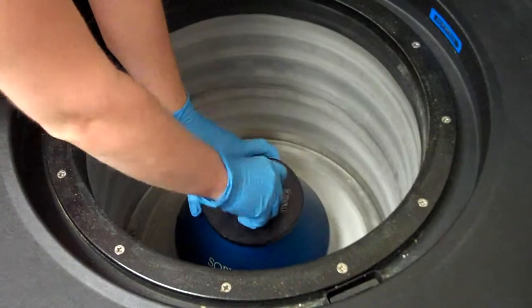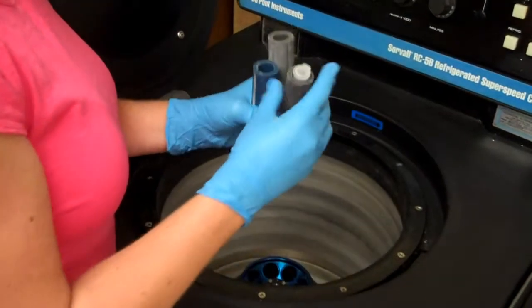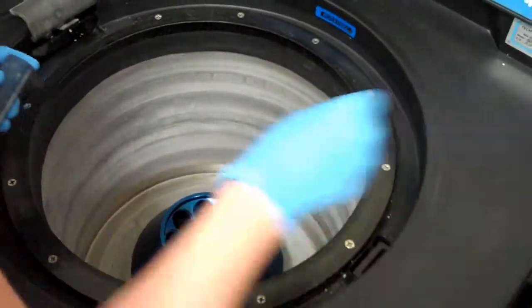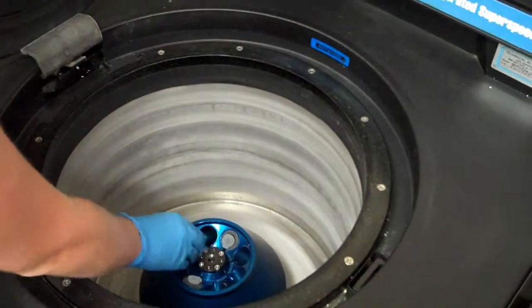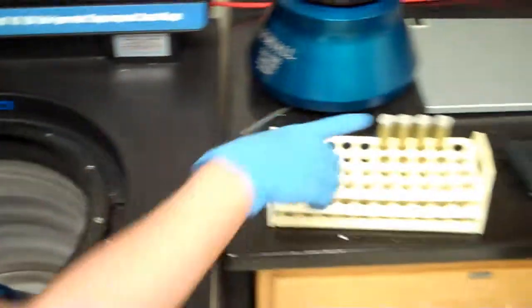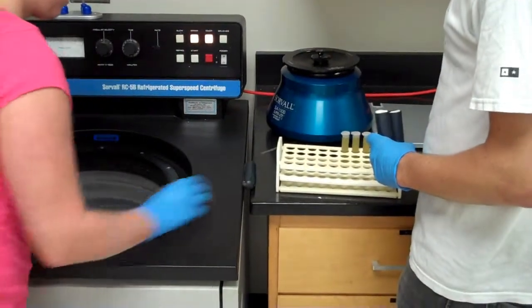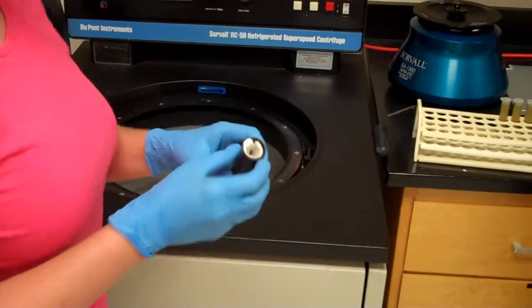Unscrew the lid. Use these rubber containers that fit perfectly with our tubes. Make sure that the centrifuge is always balanced properly. These smaller ones we have stuffed with paper towels because they're a lot thinner than the other ones.